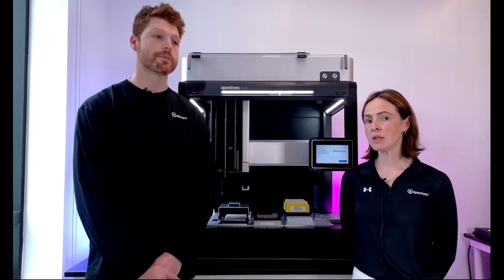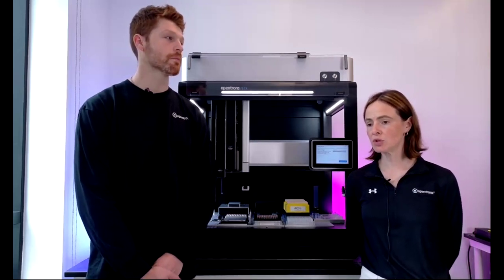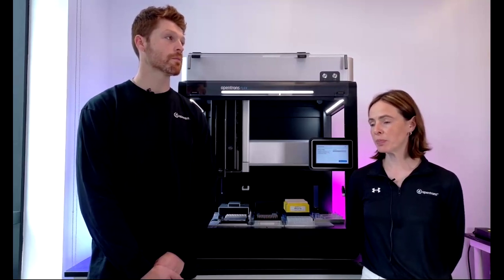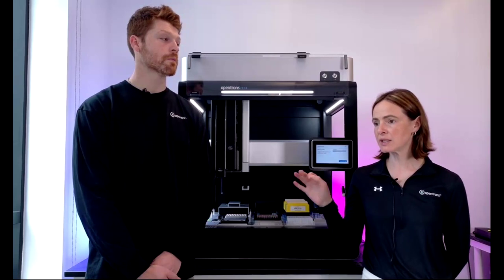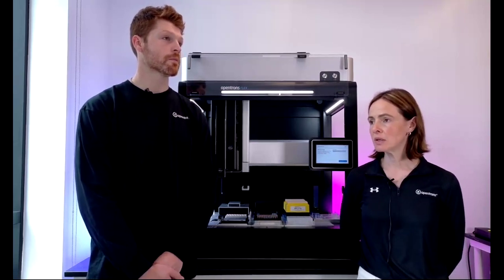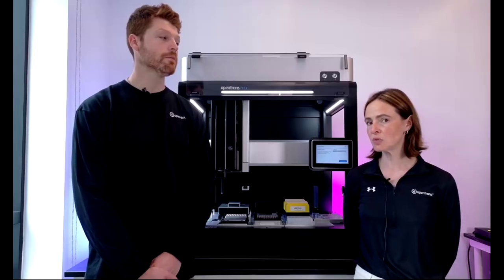Yeah. And I think there's also other things you can tweak, right? You can choose the right labware. Depending on where your pellet is, you can position your pipette on the X and Y axis so that you're pipetting to the side of the pellet, so you're not disrupting it. There are lots of little tricks that can get as much of the supernatant out as possible.